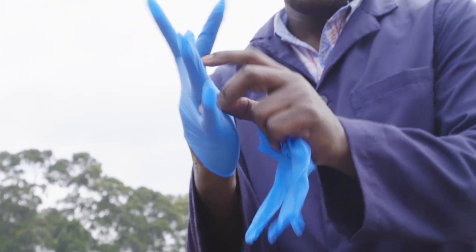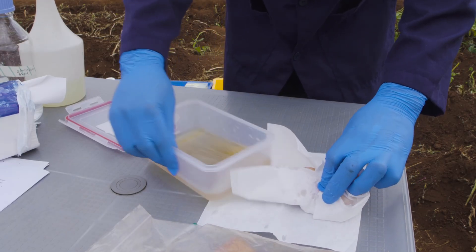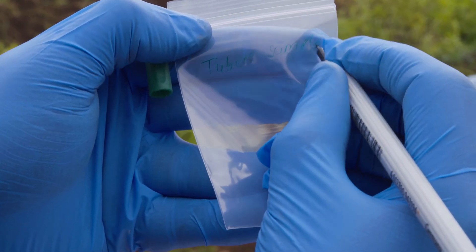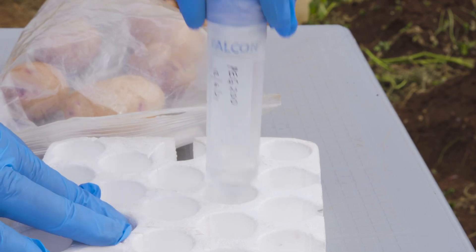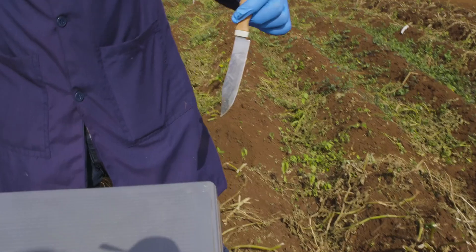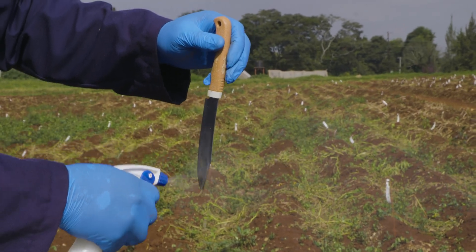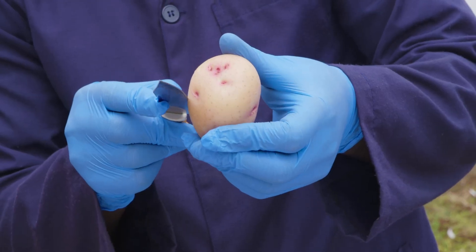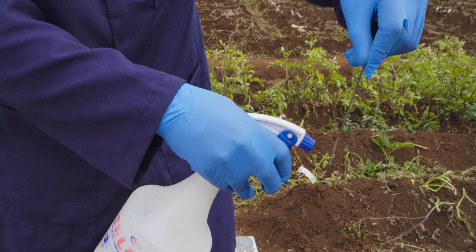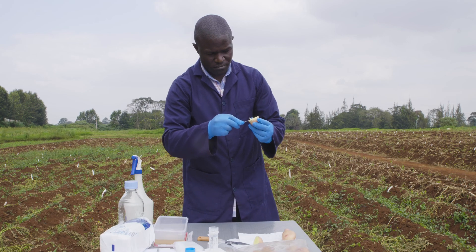To prepare your tuber samples for maceration, begin by washing or wiping the tuber surface with sterile distilled water followed by 70% ethanol. Dispense 2 ml of alkaline PEG reagent to labeled plastic sample maceration bags. Treat cuticle remover or blade being used with 70% ethanol to eliminate DNA contamination. Cut out small portion of the tuber at the stolon end to expose vascular ring. Remove the vascular ring with a sterile coring device or blade and transfer it to the respective labeled maceration bag.